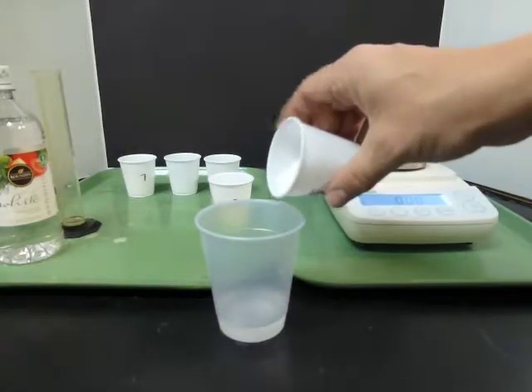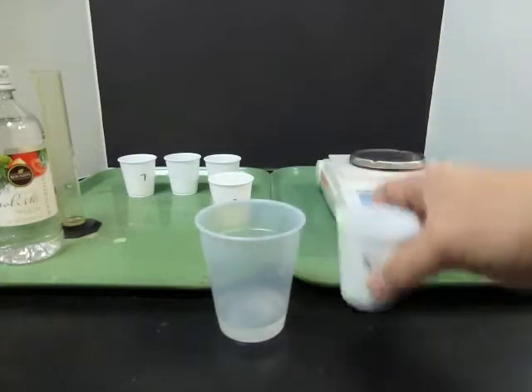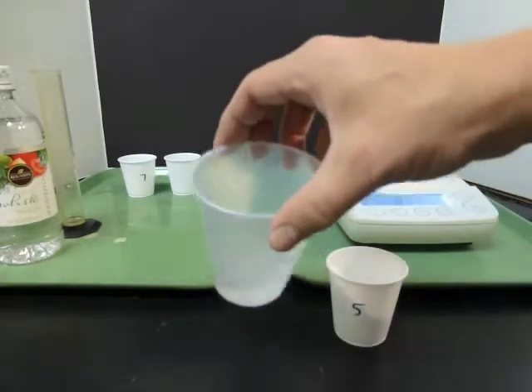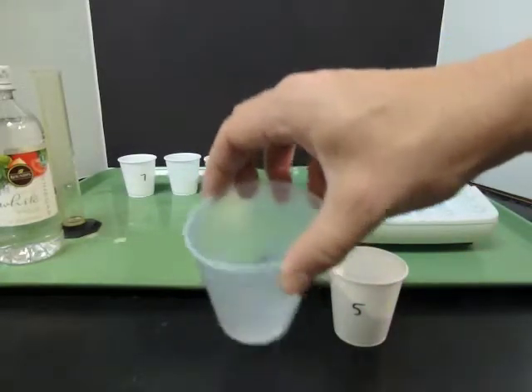And when you add it, you'll see that it fizzes. But don't add too much at a time. When you add a little bit, swirl it around, get all the bubbles out.